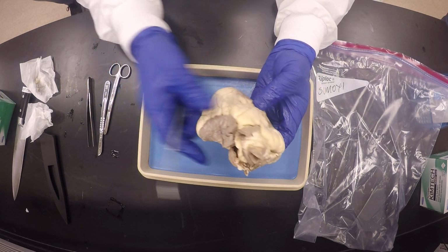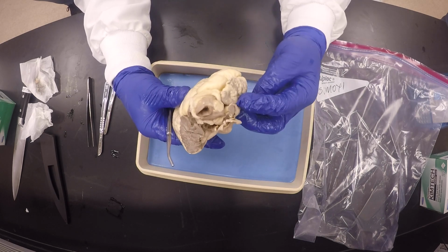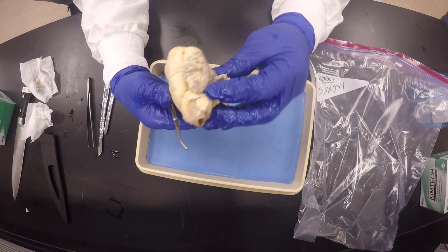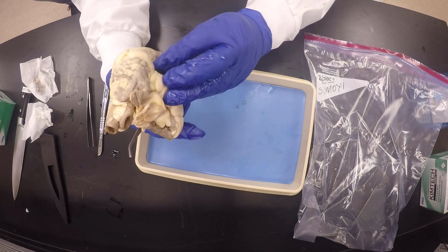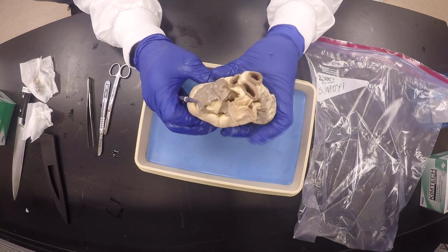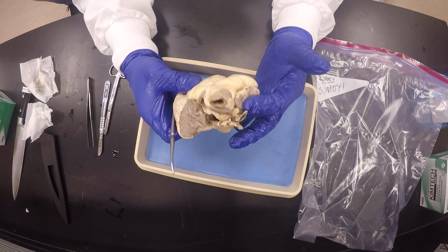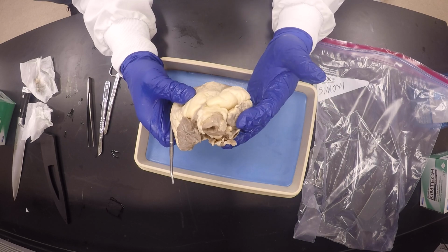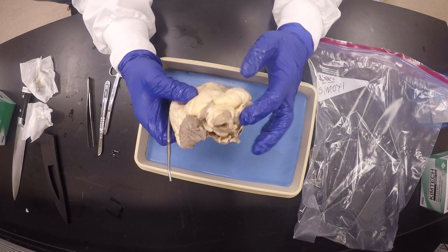And if this is the left auricle and this is the right auricle, then next to the right auricle, most likely this is the superior vena cava. And you may not see the inferior one, it's cut off. But if I point to the right auricle and ask what's that blood vessel, you would have to say vena cava, because you probably don't see it. You can say superior or inferior, I don't mind, but it's vena cava.